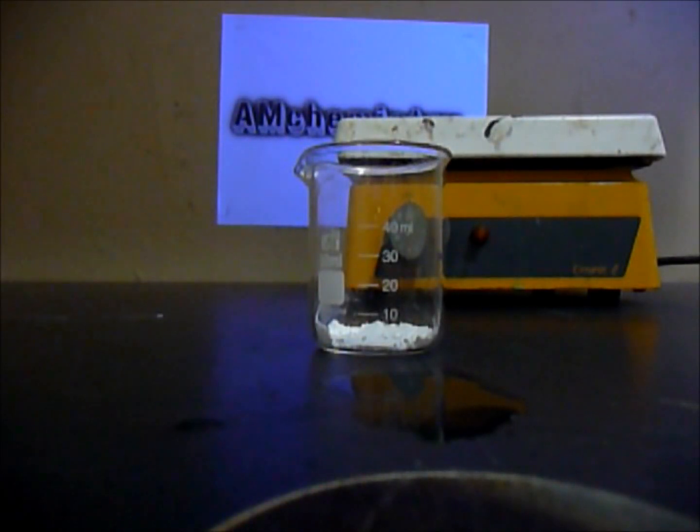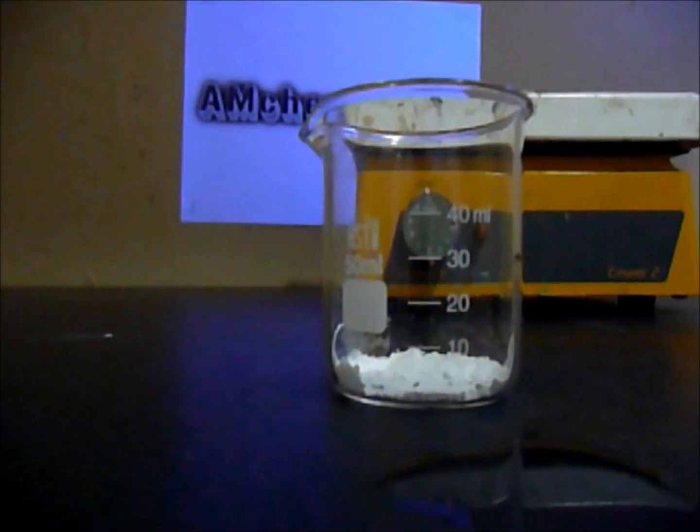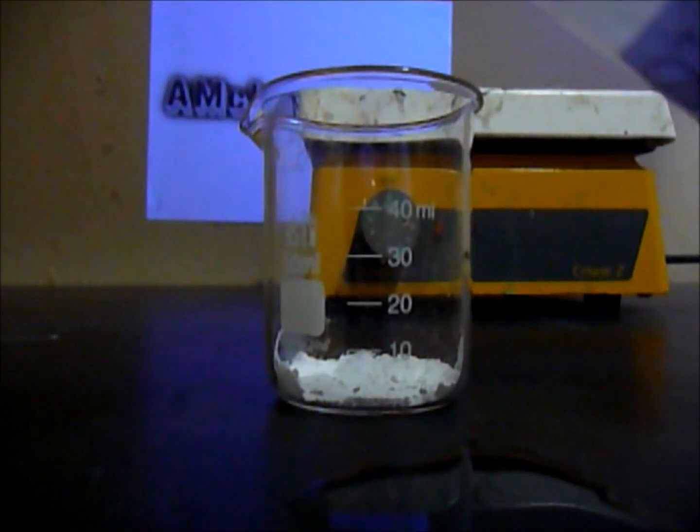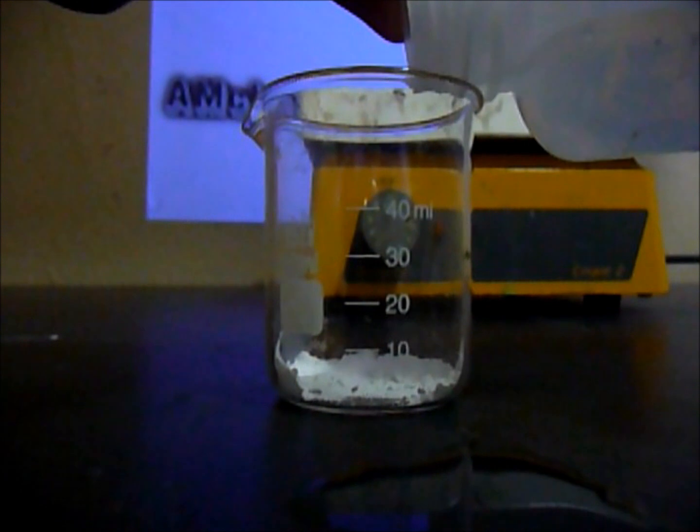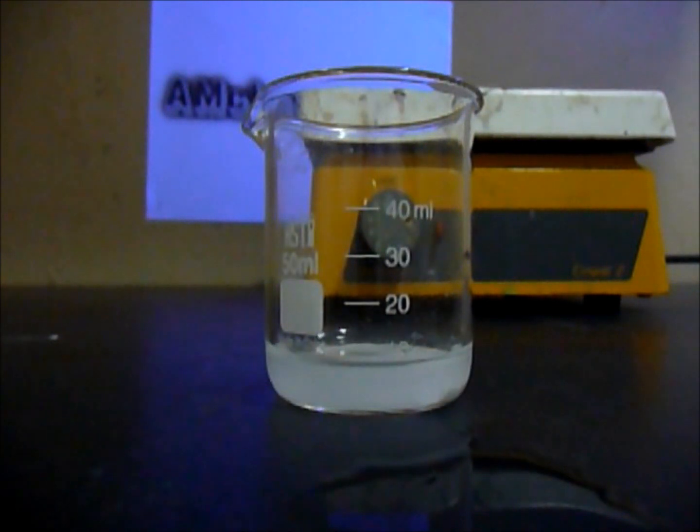Now that it got colder, you could just add some water. I'm adding a little bit of water, probably like 10 milliliters. Now, just stir it with the stir rod.